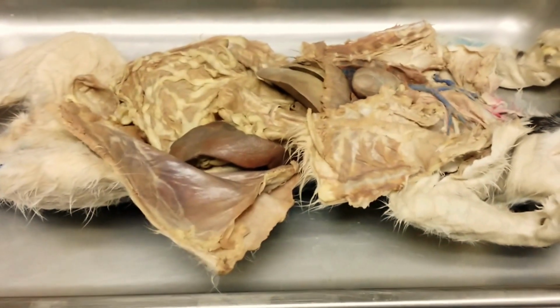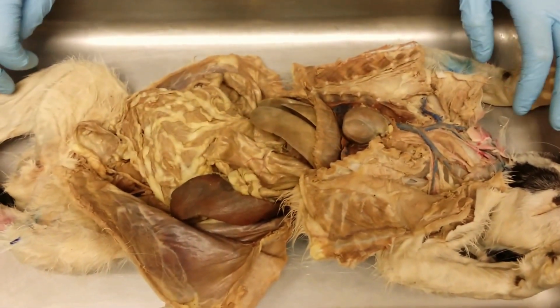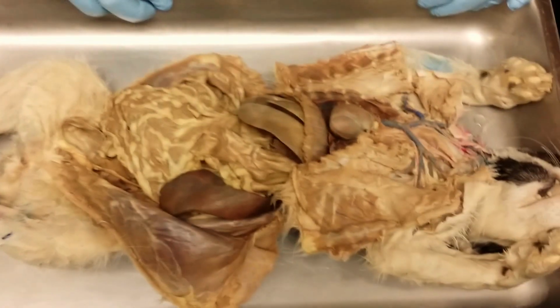Yeah, this is the last time I'm going through the cat. Do you want to come? I'm going to go through the digestive organs.